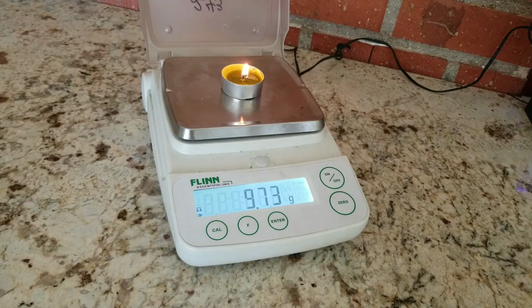That's our 120 seconds. Looks like we're still at 9.73. That is our 150 seconds.